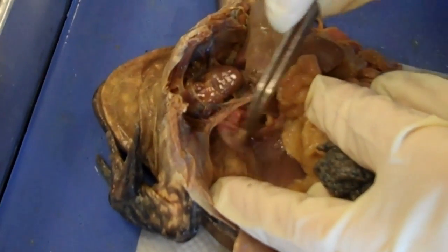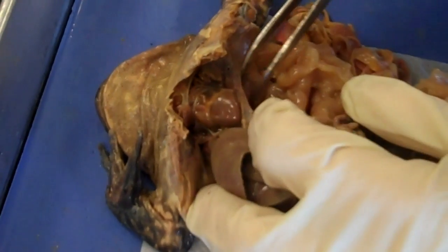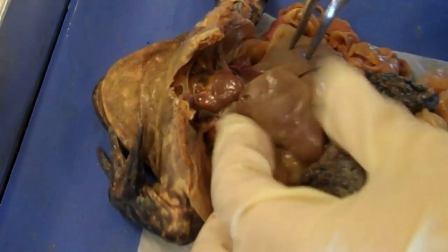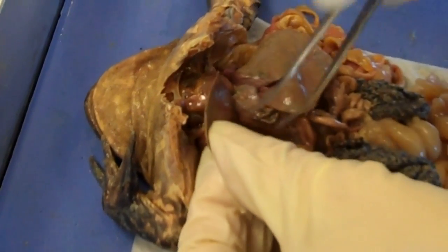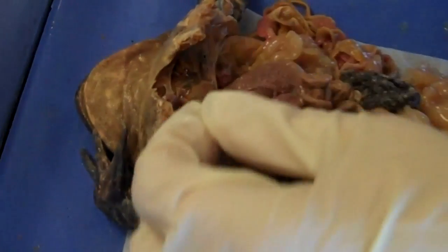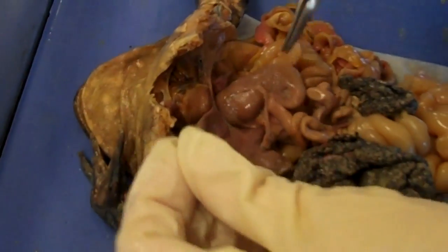On either side of the heart, you're going to find the lungs — there and there. This is your three-lobed liver. Under here, gallbladder. Under here, stomach.